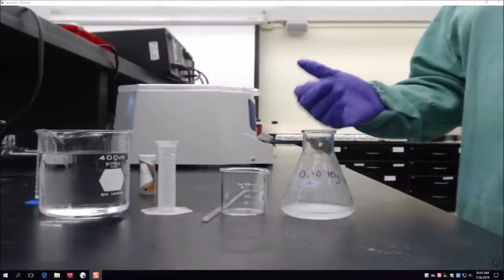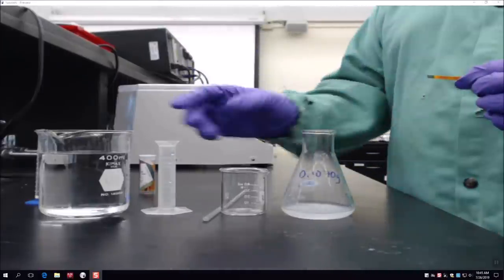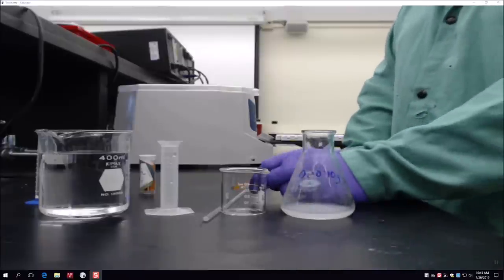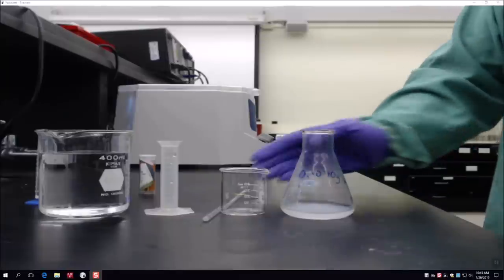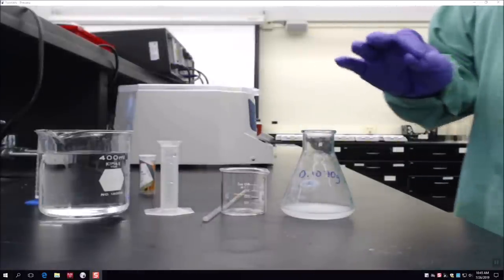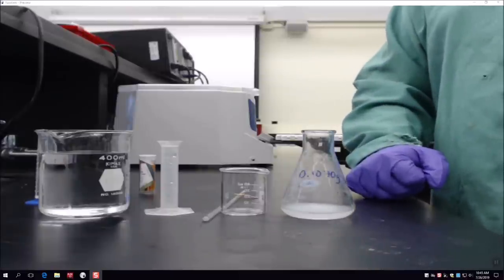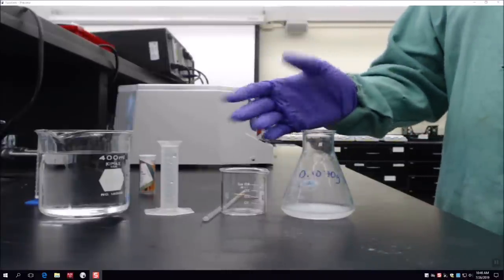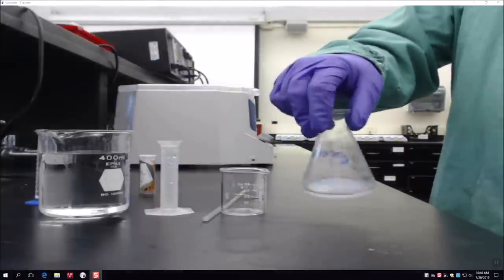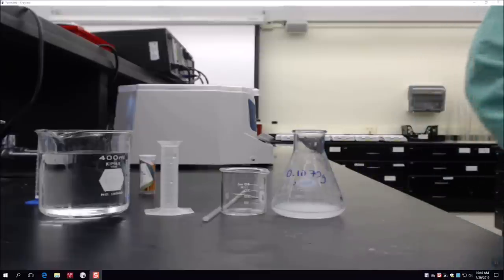NaOH is used in excess, so now we have NaOH dissolved in solution, which is basic — that's why our pH paper shows a basic solution. If you didn't form precipitate and found it still acidic, all you would do is add more sodium hydroxide. It's important to only add as little as needed to form your precipitate, because if you add too much, then in the next step when adding sulfuric acid you'll have to add a huge excess of acid as well. Add it a couple milliliters at a time.